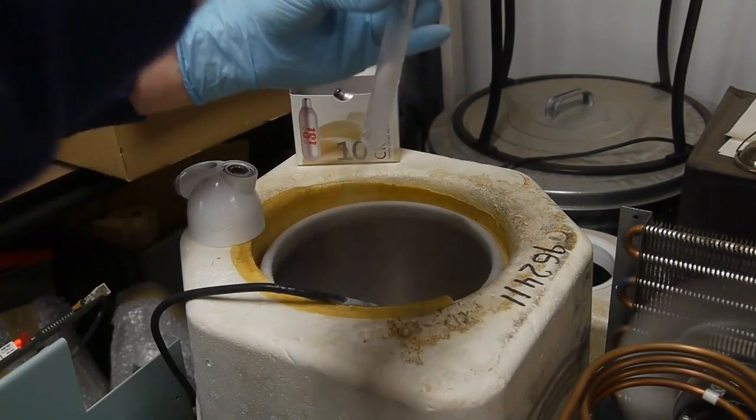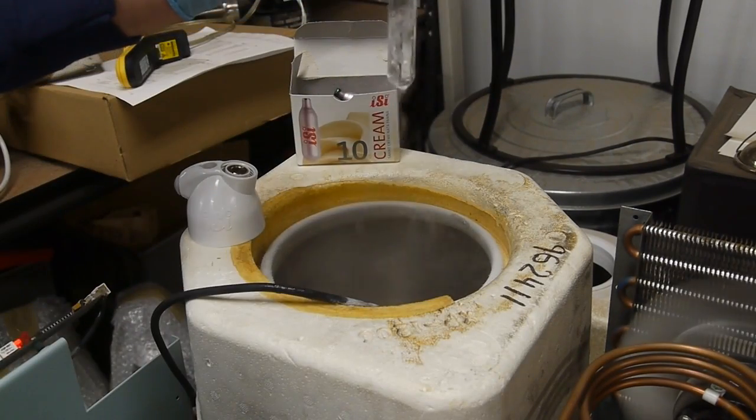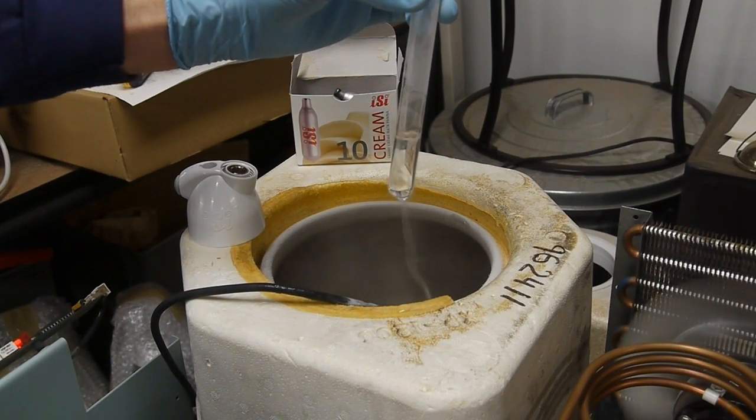If I put it over a test tube, now we have a test tube of liquid nitrous oxide. I'm going to put this back down in the cold chamber to keep the boiling down.